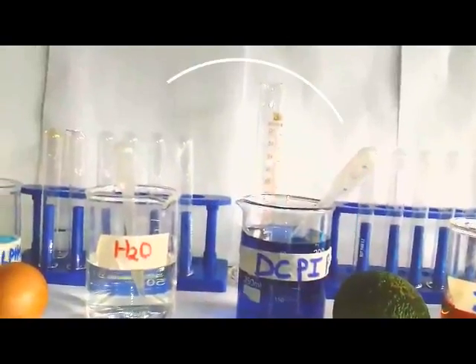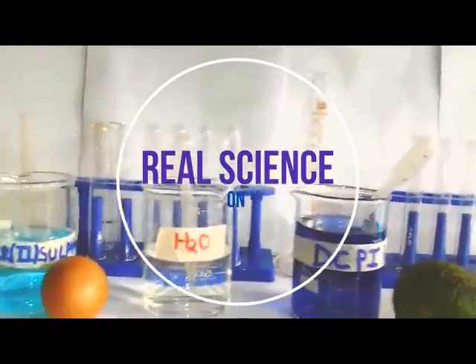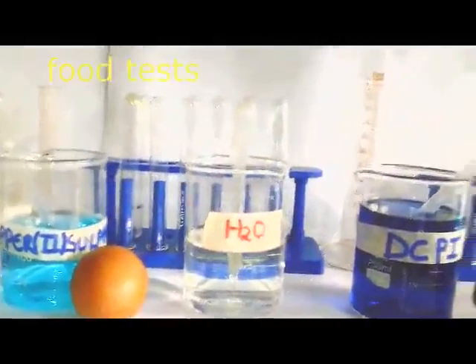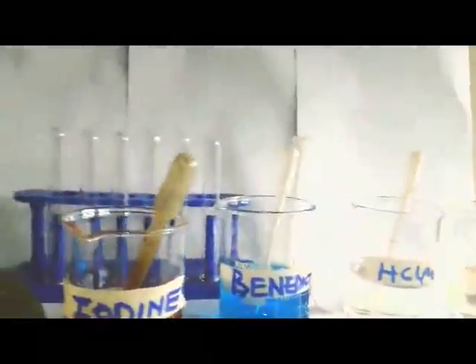Members, today we are back in our biology, and today our emphasis is going to be on what we are calling practical biology, and I'm going to consider what we are calling physiology. Physiology, mainly, we can look at food tests, and processes like diffusion and osmosis, but today my idea is going to be food tests.